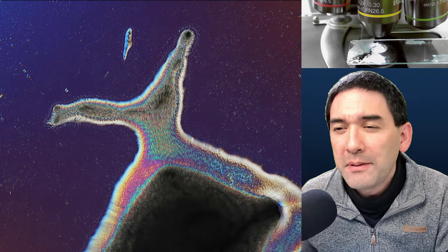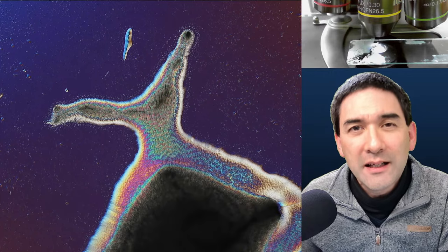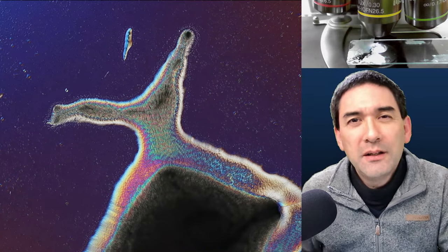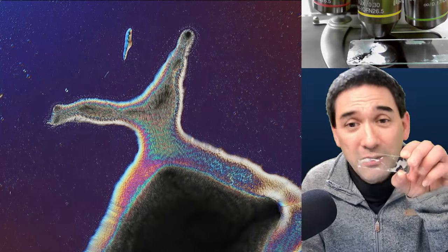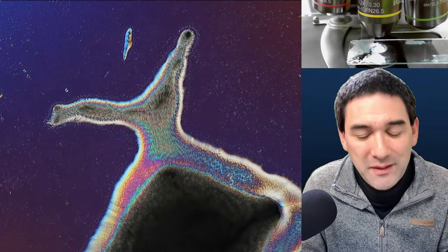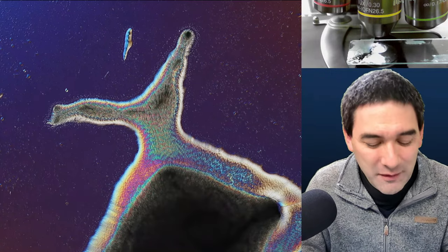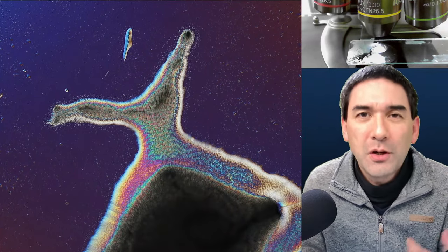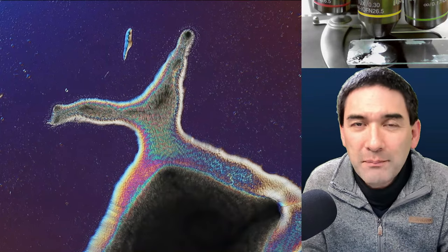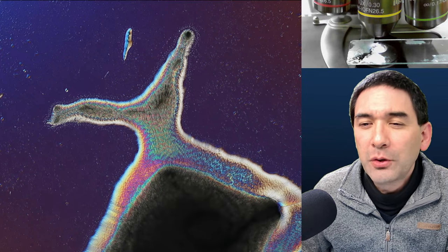There's a question about what type of alcohol I used — IPA or ethanol. I just used regular ethanol. The reason I added ethanol to the vitamin C is that vitamin C doesn't dissolve well in ethanol, but it breaks the surface tension so the liquid spreads better across the slide.